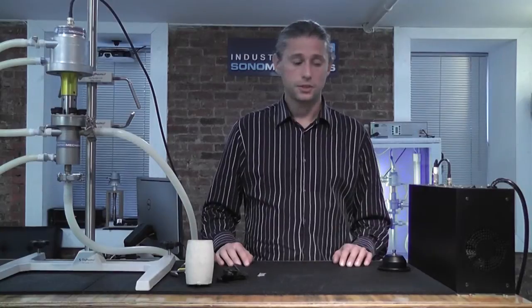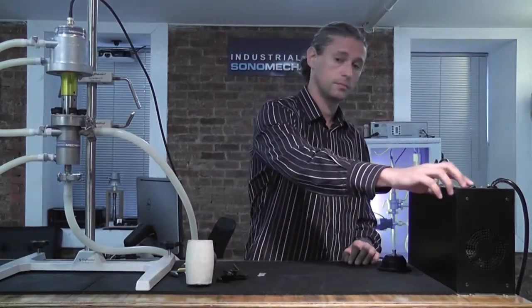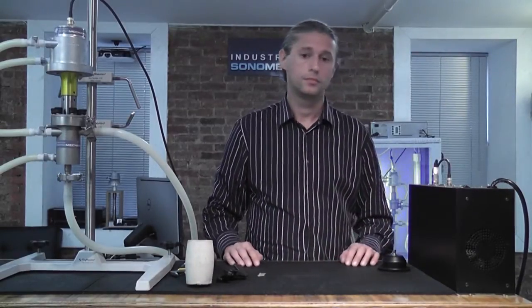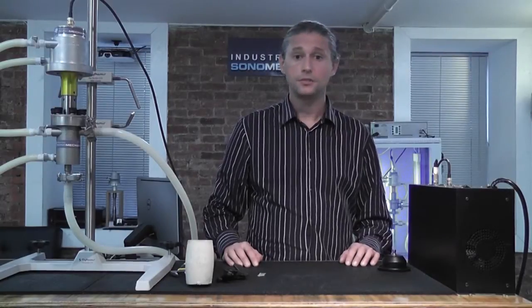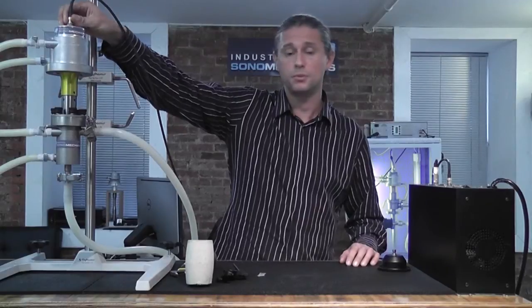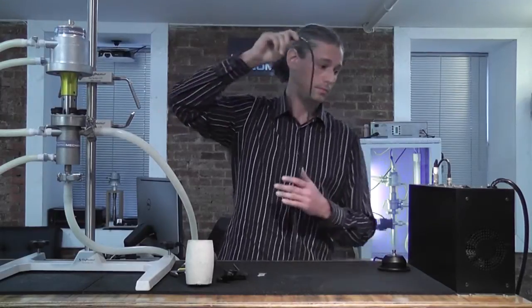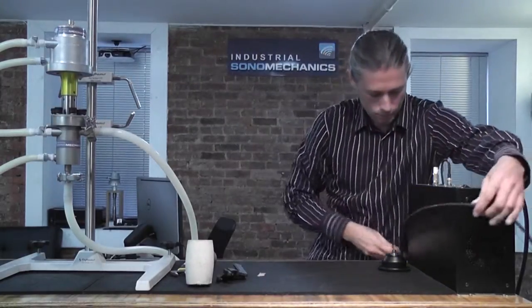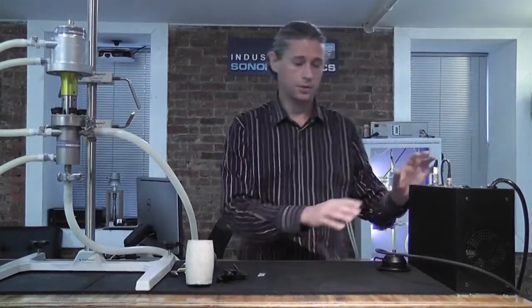We're now ready to disassemble the system. Step one is to turn the generator off, and wait a few seconds. After this is done, disconnect the ultrasound cable from the top of the transducer. We're done with this part.